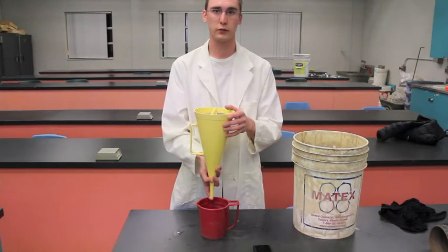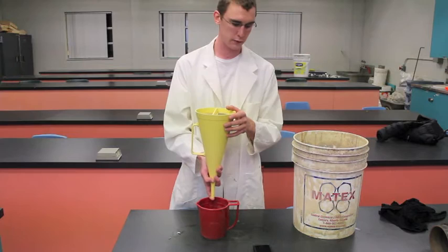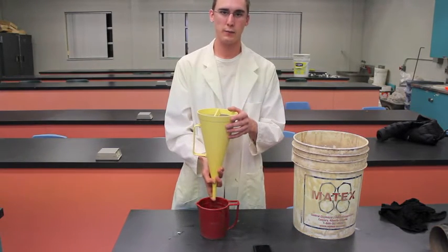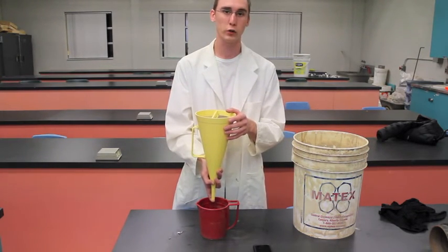And now for this step, you're just going to measure the viscosity. So I'm going to let go of my finger, I'm going to start the timer, and then we're going to time to see how quick our mud fills up the one quart container.